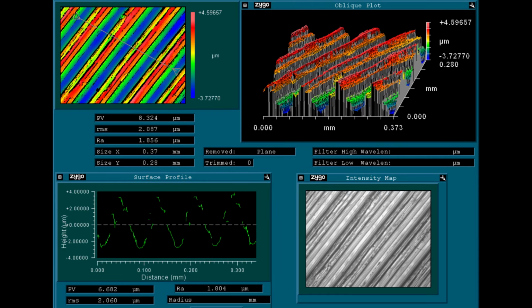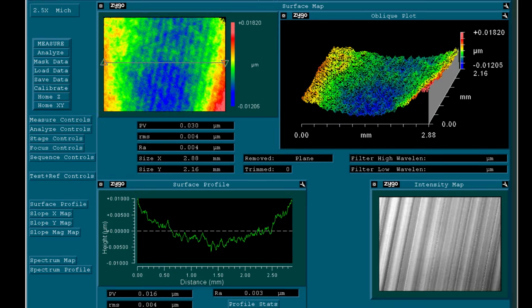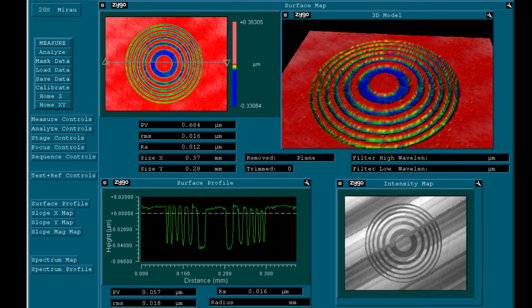Now the software can give us all kinds of values for the surface roughness like peak to valley, RMS and arithmetic average, which is a pretty cool feature because these are generally specified as surface tolerances for the manufacture of parts. Now I looked at many different surfaces ranging from plastics and glass surfaces, fiber plates, zone plates and even chip patterns.